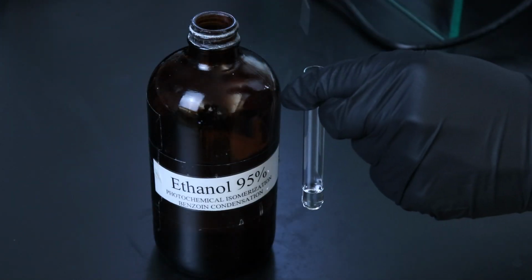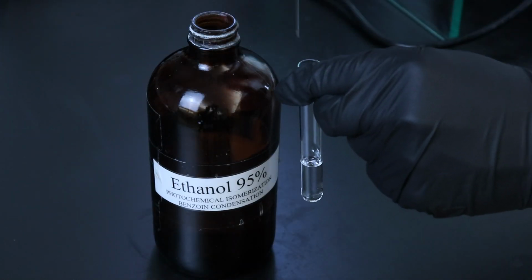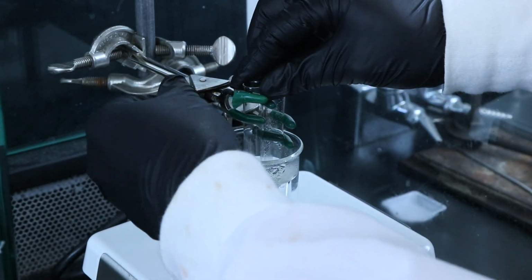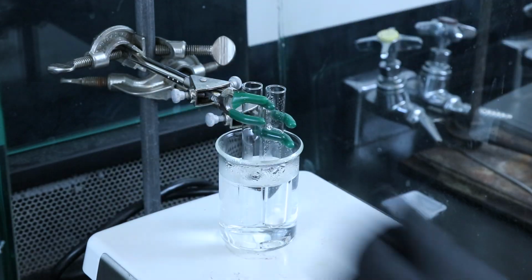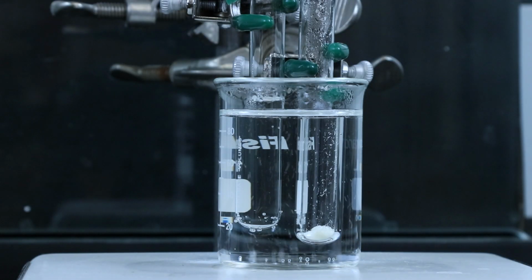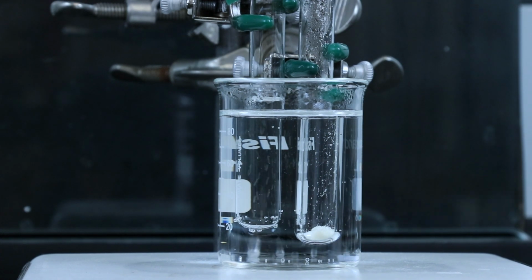Using a Pasteur pipette, you can add some of that solvent to a separate test tube and place that into the hot water bath as well so that it's also at a higher temperature when you add it to the product. To make sure that everything remains at a steady hot temperature, the water should be boiling or even the solvent boiling, but at certain parts in this video it can be hard to see everything that's going on with the solvent boiling, so I may turn it down a little bit.